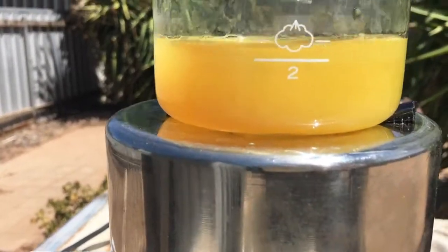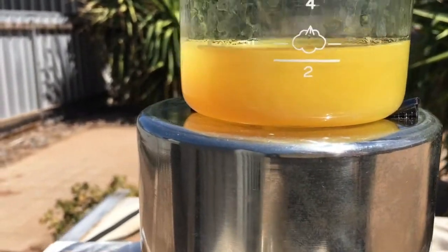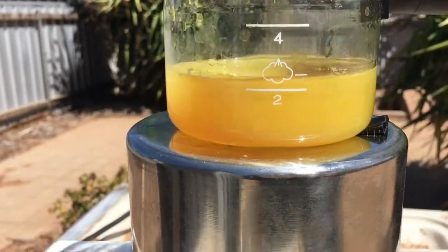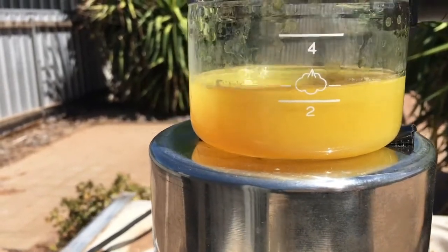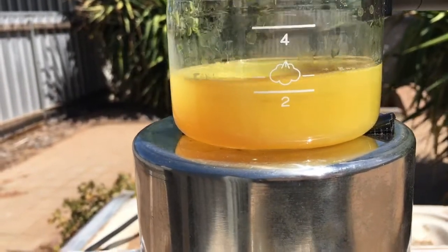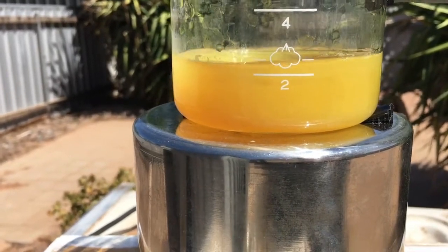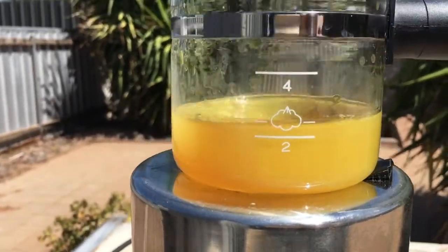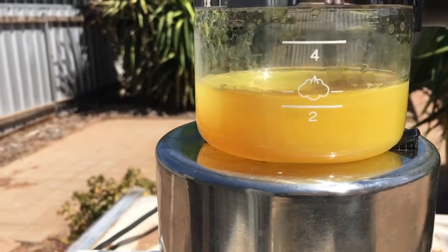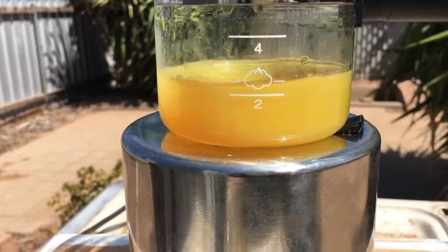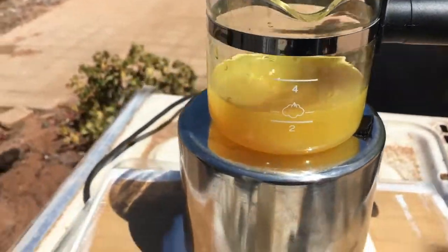So far so good. It's looking like orange juice. I've only added about 9ml of zinc sulfate so far in about 15 minutes. So I'm counting about 10 seconds every drop, thereabouts. I'll get back when I'm further along.